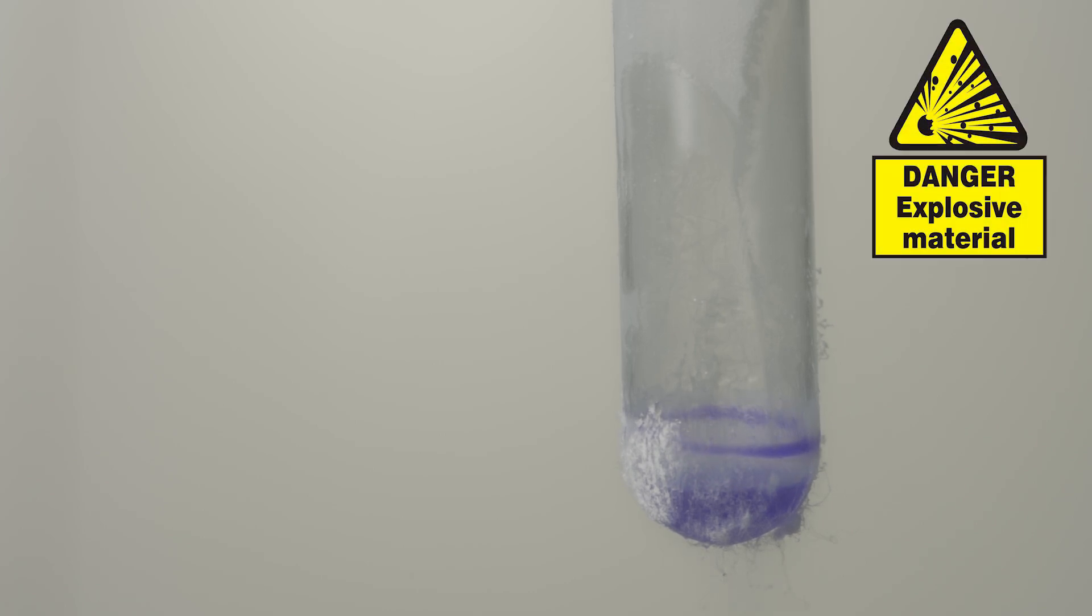Since I have liquid ozone instead of ozonated oxygen here in the test tube, I didn't touch its bottom to clean up the layer of ice, because it may result in the explosive decomposition of liquid ozone.